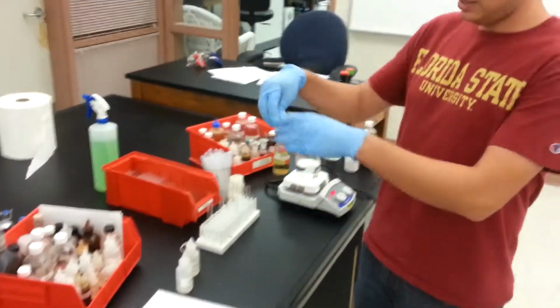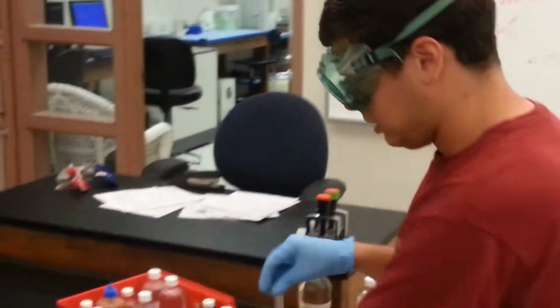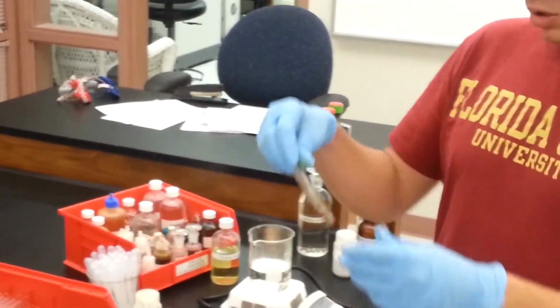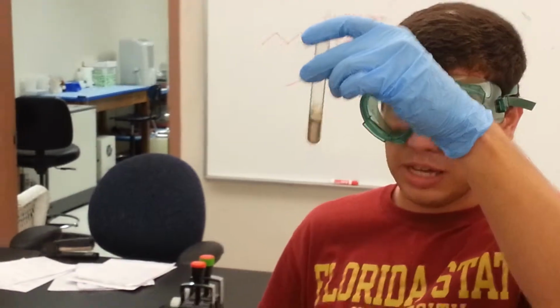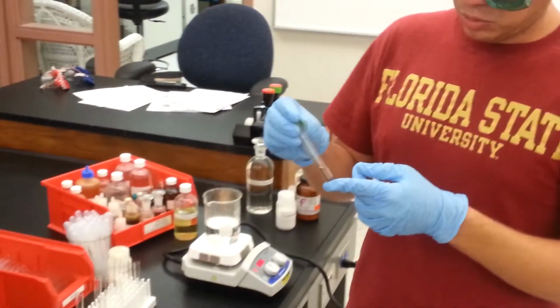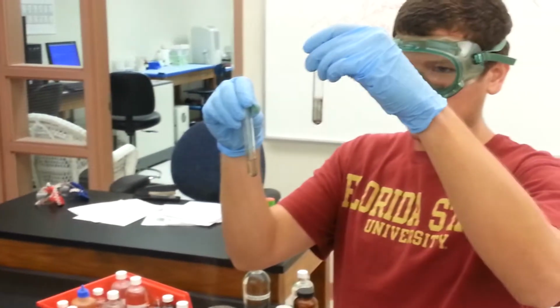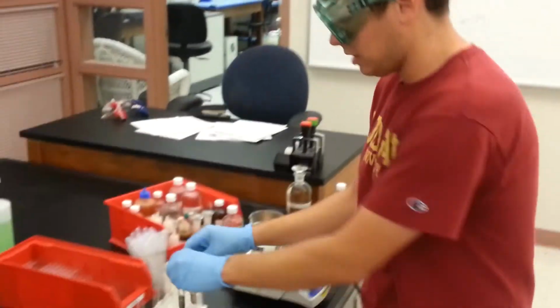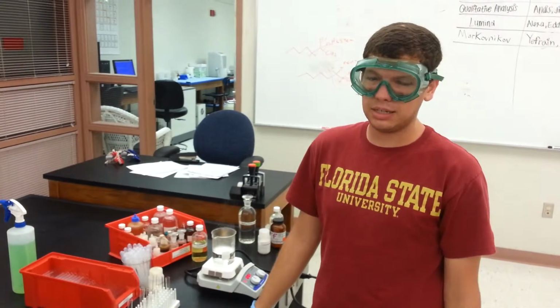As we can see, we have a bright metallic sheen on our methyl ethyl ketone sample, and our tert-butanol actually had, it looks like, some of the reagent come back out of solution, and we've got some of that precipitate back in the bottom, but you can see it's not the metallic sheen from the other sample. Now I'll hand it back to Audrey for an anhydride test.